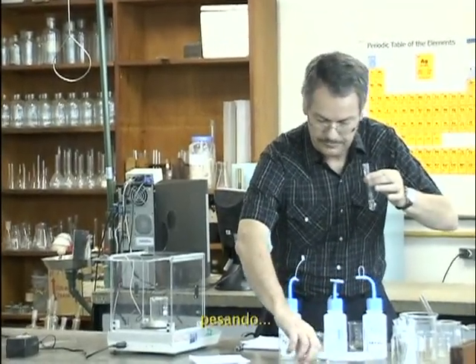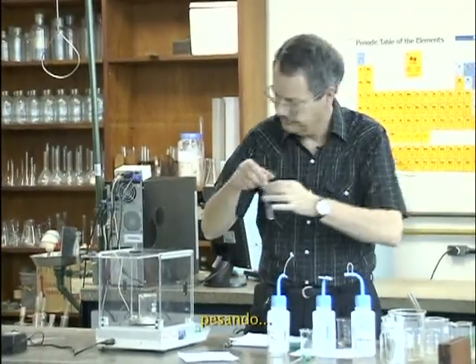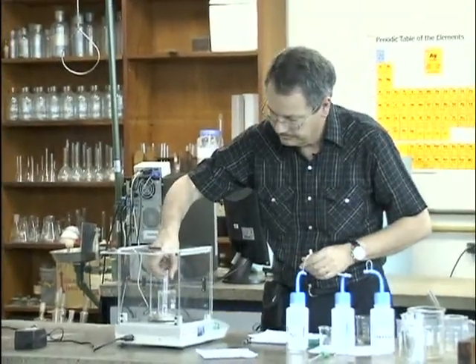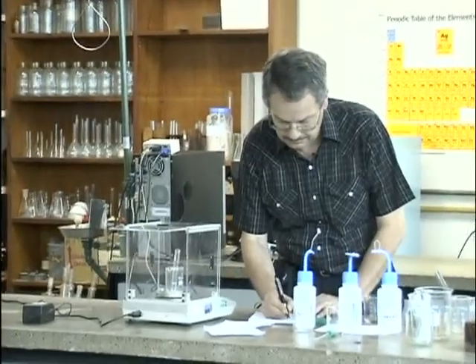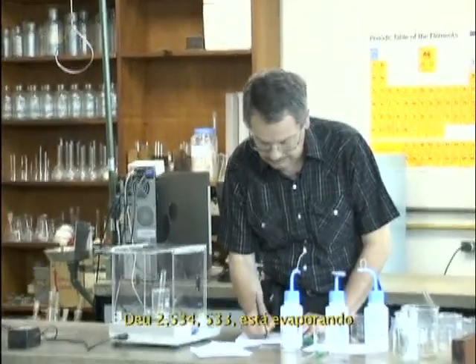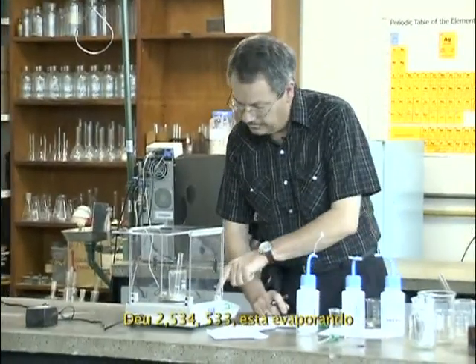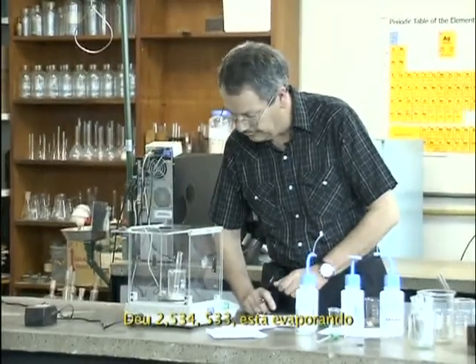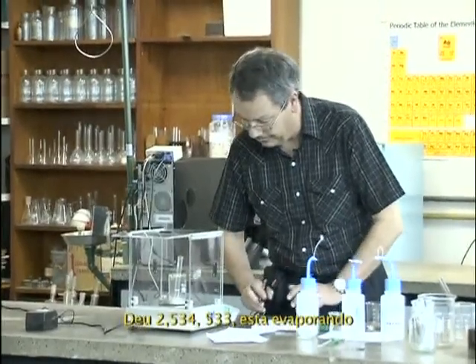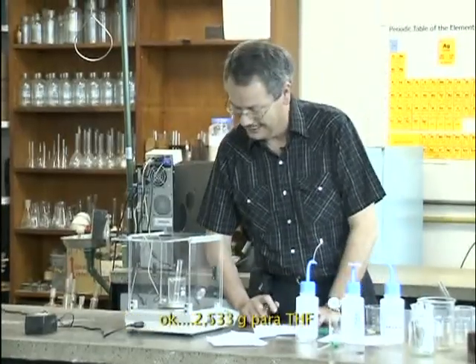Could put this one, weigh it, write it down. And I read 533, it's evaporating.